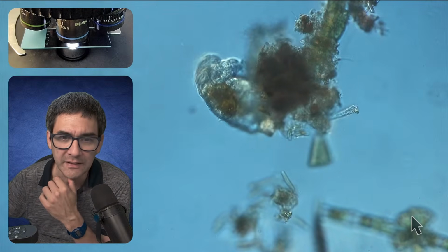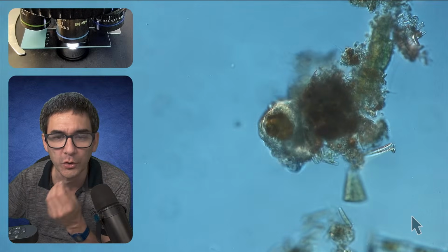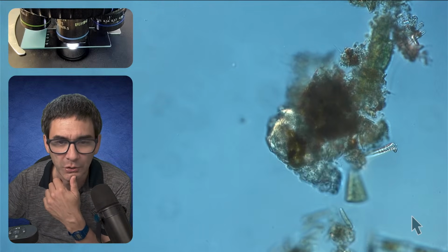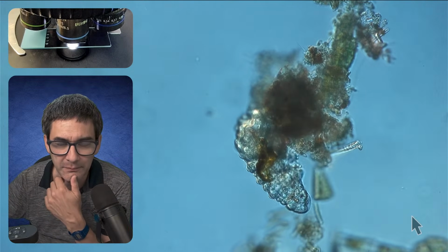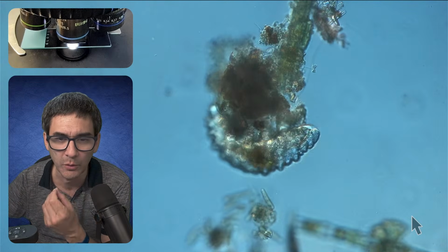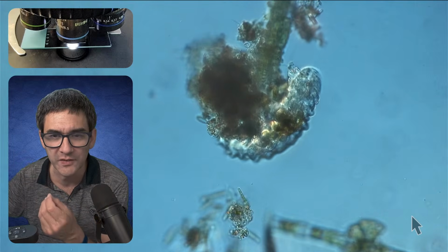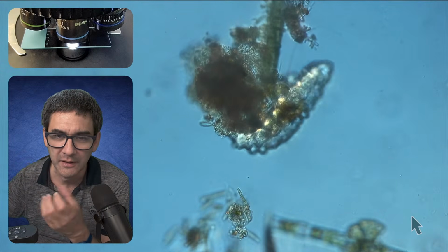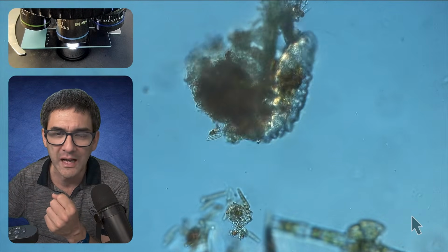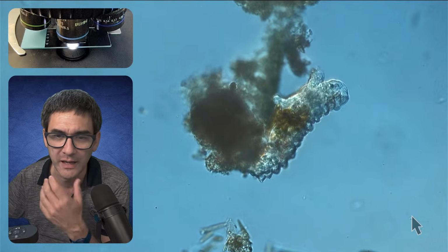They have so-called ganglia, and ganglia are basically a collection of nerve cells. So it is not a fully developed brain like we know it. However, it's not completely decentralized either. There is a collection of nerve cells that function a little bit like a brain. Of course, higher thinking ability or intelligence is not something you have here.